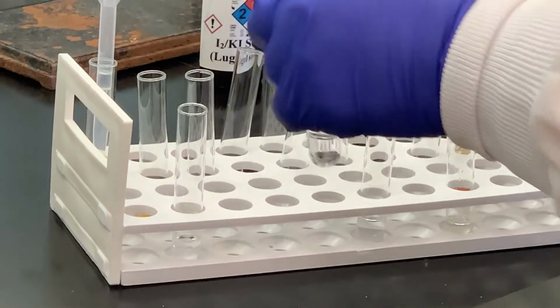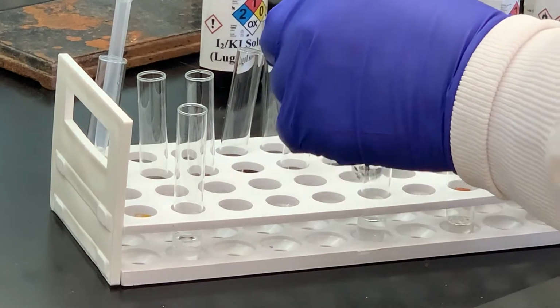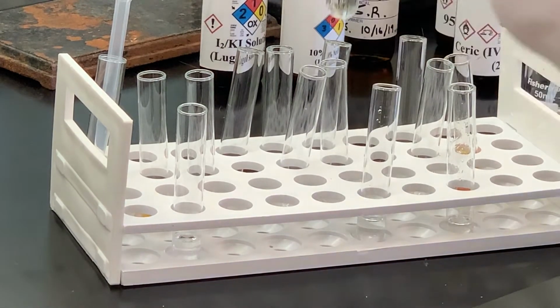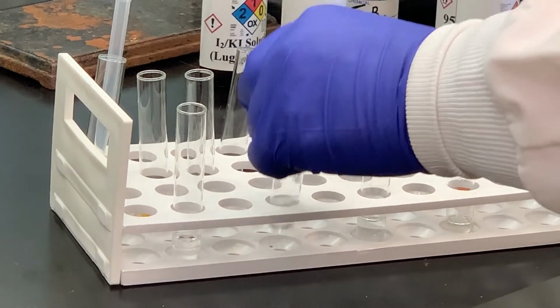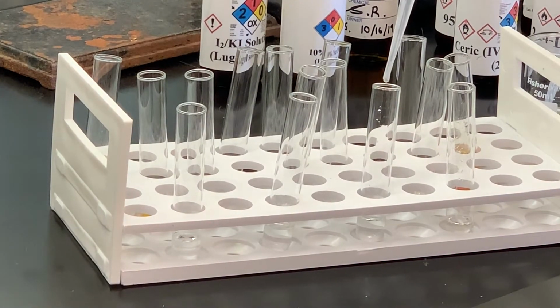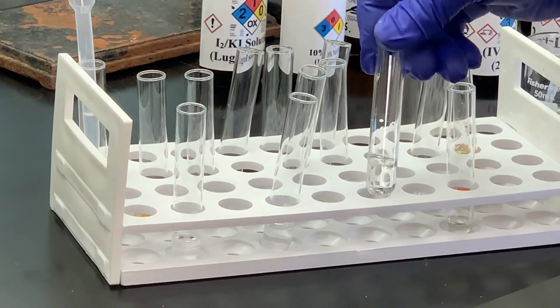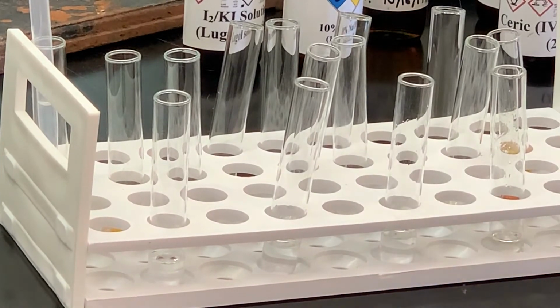I'm going to take the sodium hydroxide solution, add enough so there'll be no question about its solubility, and I will stir these stronger acids and bases with the stirring rod. But you can see that you've got the 2 layers that have formed. Then I'm going to add some of my unknown to the hydrochloric acid solution. I'm just going to add a little bit more because of that layer, and you can see that top layer. So it's insoluble in hydrochloric acid.